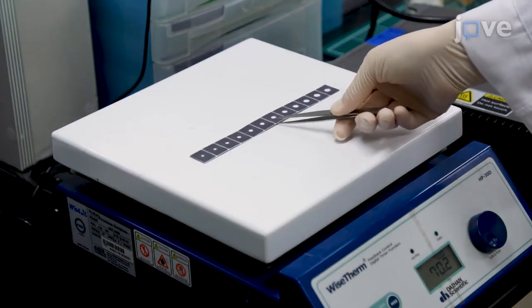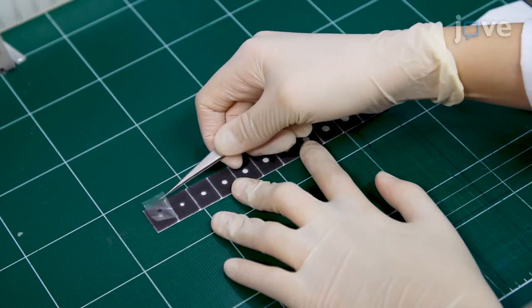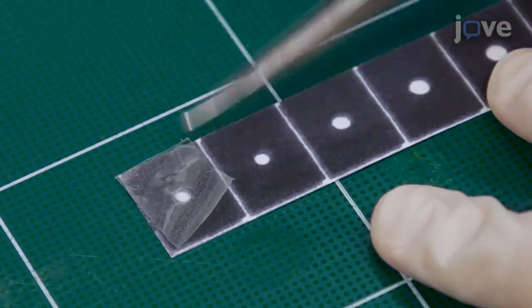Place the layers coated with the perm-selective membrane on a hot plate at 70 degrees Celsius for 30 minutes to evaporate the solvent. Then, seal the outermost surface of the coated layer facing the buffer solution with pressure-sensitive tape, leaving a small hole.